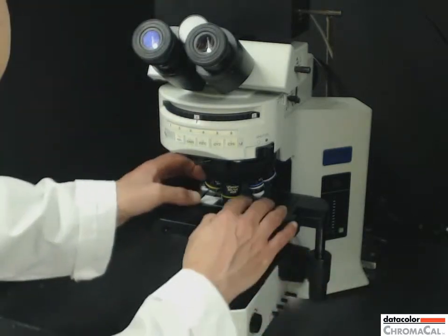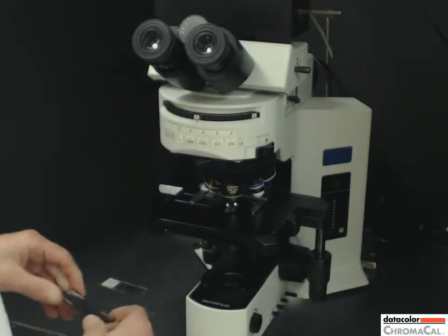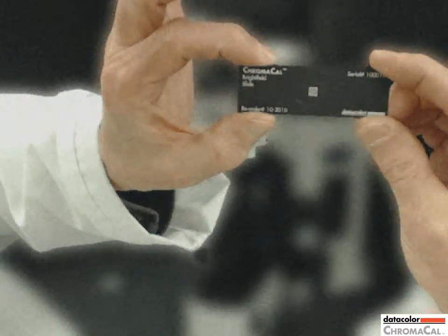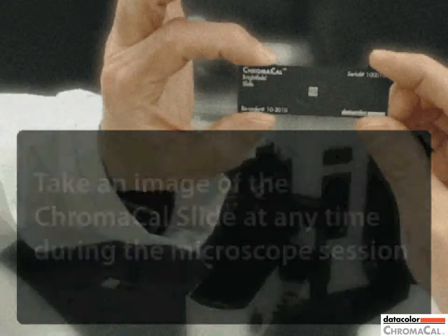Take your specimen slide off the stage and insert your ChromaCal calibration slide. Here is some overall guidance regarding the use of the ChromaCal slide. Take an image of the ChromaCal slide at any time during the microscope session.